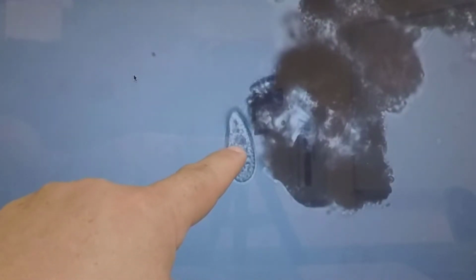Here you can see the feeding groove of this organism consuming material, and you can see it on the inside, and then you can see these little teeny hairs all along the outside beating extremely fast. Those are cilia, and so they'll have cilia in their feeding groove also, which is pushing food into kind of their mouth, I guess you could say, and that organism is feeding right there.